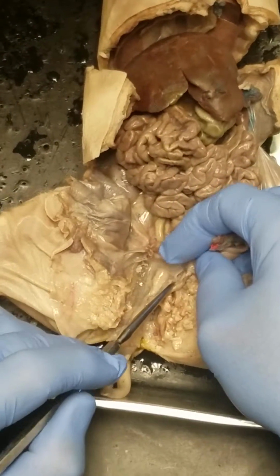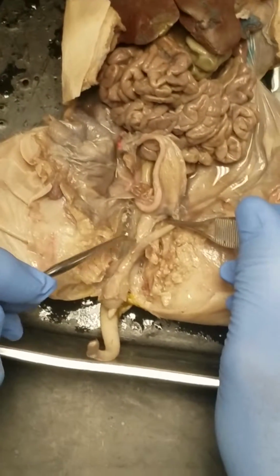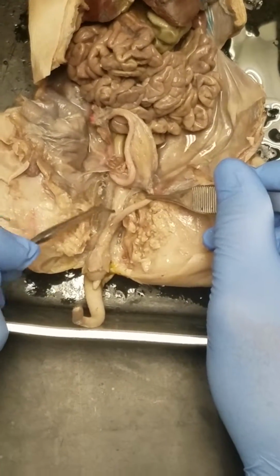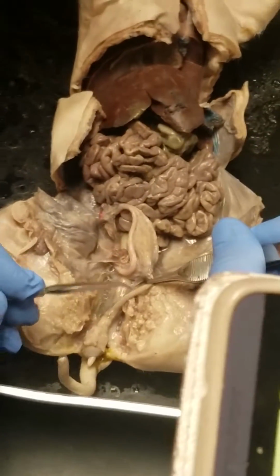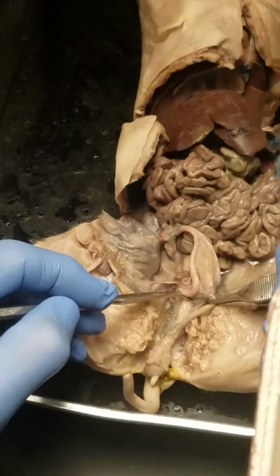So here's the urethra. Let me do it this way. Pull the urethra over this way. So we have a V. So urethra, vagina, vaginal vestibule. Which one is the vagina? It's after the urethra there, it connects with it. See how we got that Y-looking thing again? There's the trunk of the Y, and there's the two branches. The branch going to the bladder is urethra. The other branch is the vagina.